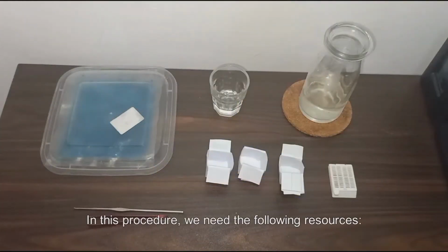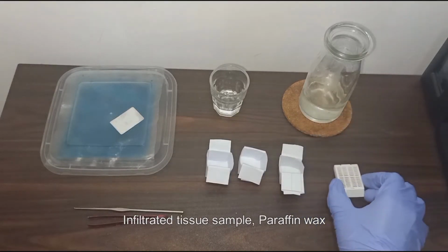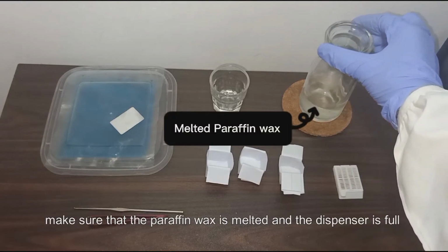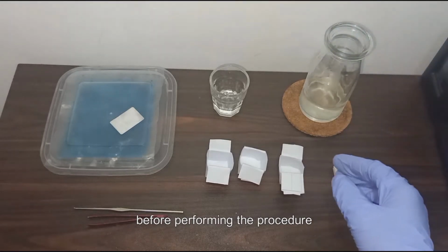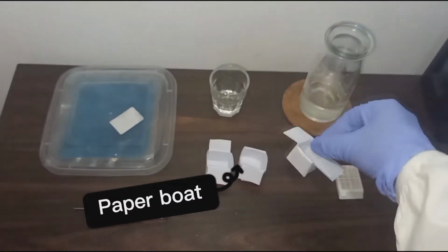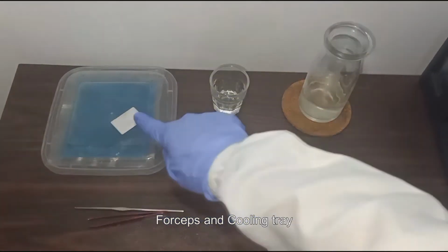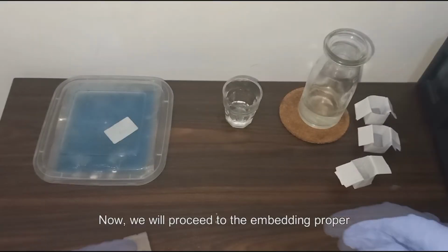In this procedure, we need the following resources: infiltrated tissue sample, paraffin wax. Make sure that the paraffin wax is melted and the dispenser is full before performing the procedure. Paper boat, forceps, and cooling tray. Now, we will proceed to the embedding proper.